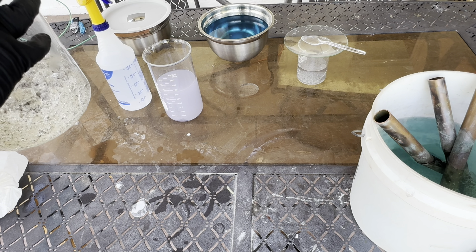Silver chloride is still recoverable using sodium hydroxide and table sugar to reduce it and get it back into metallic state. I'm going to clean this out and test our solution after the next couple of boils of hot distilled water to see if we have any more chlorides present. I've also got the silver cell bowl wired up and ready to go back into action. I'm going to put the old used silver nitrate back in here and finish running the rest of the silver. I've got silver crystal and a couple of silver coins and bullion — I'll top this off to add a higher concentration of silver nitrate back to the solution to make it more alive, and add a little water.